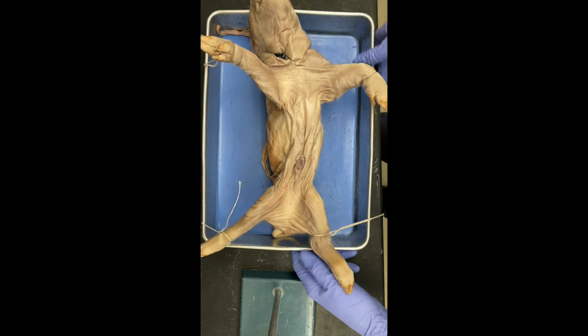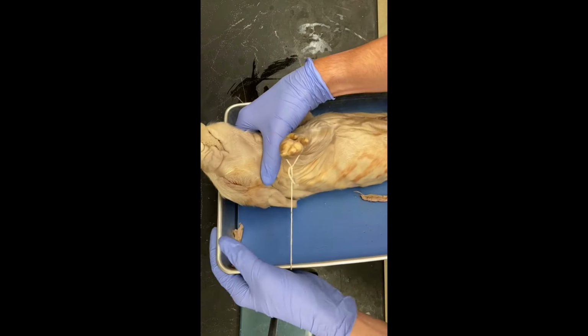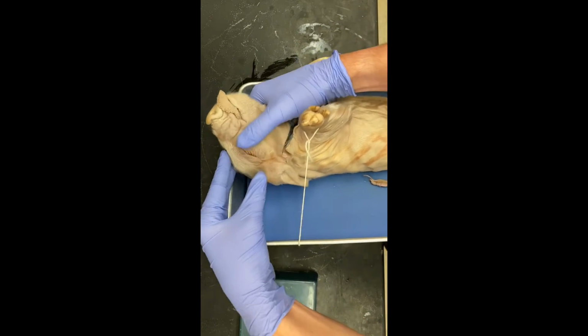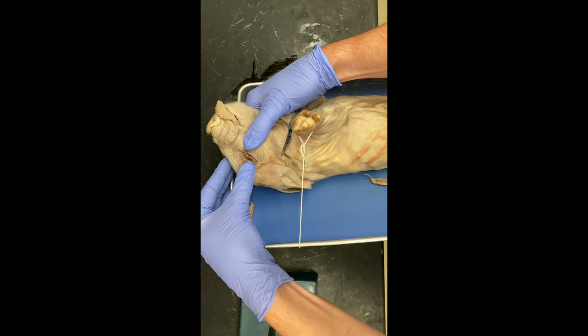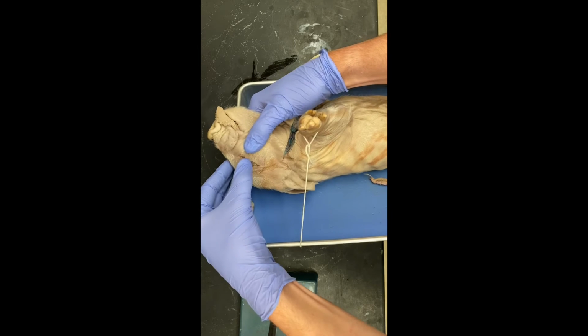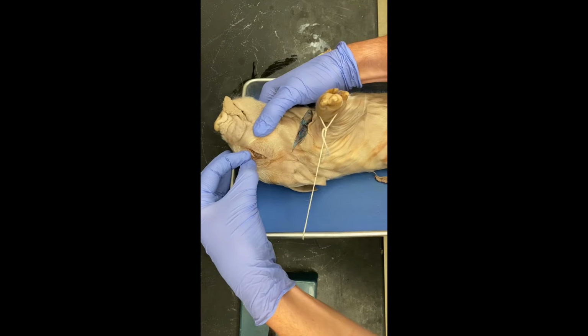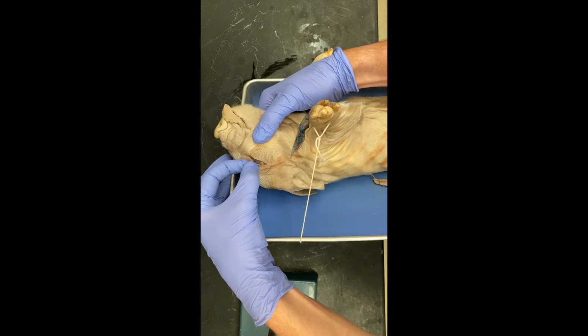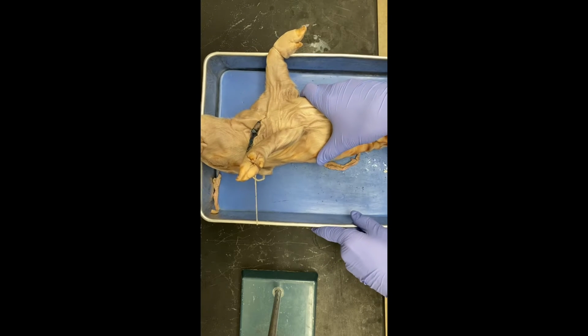The nictitating membrane is in the eye of the pig, and in previous animals such as the salamanders and the frogs, it was a whole membrane. But on the pig, it is just a small mass of tissue right at the corner of the eye. It's right there. You can see it. It's very small and not very noticeable on these animals, and it's used to help protect the eye, and it keeps it clear.